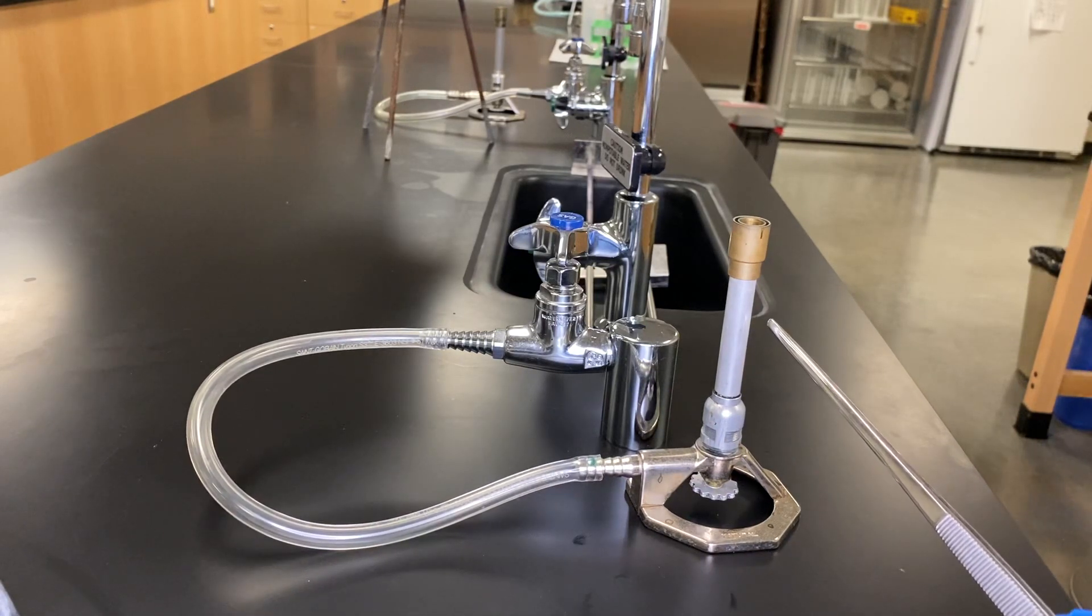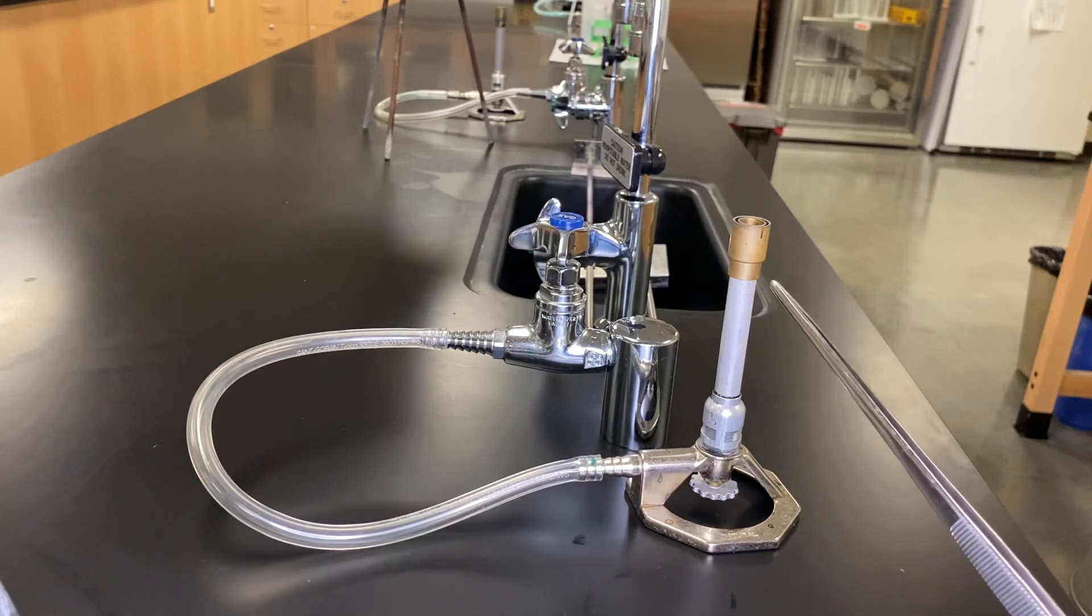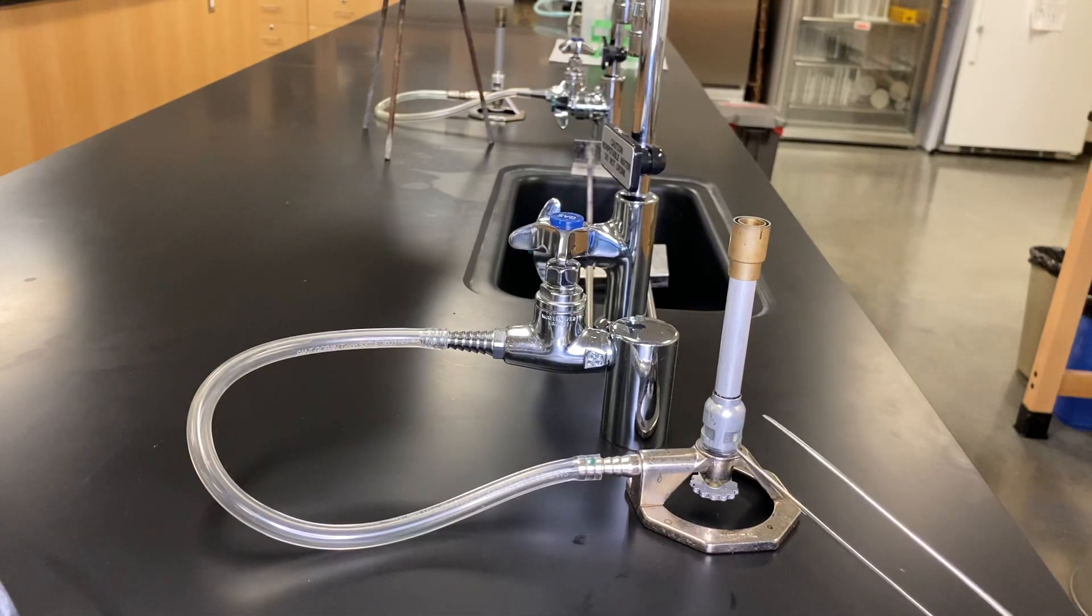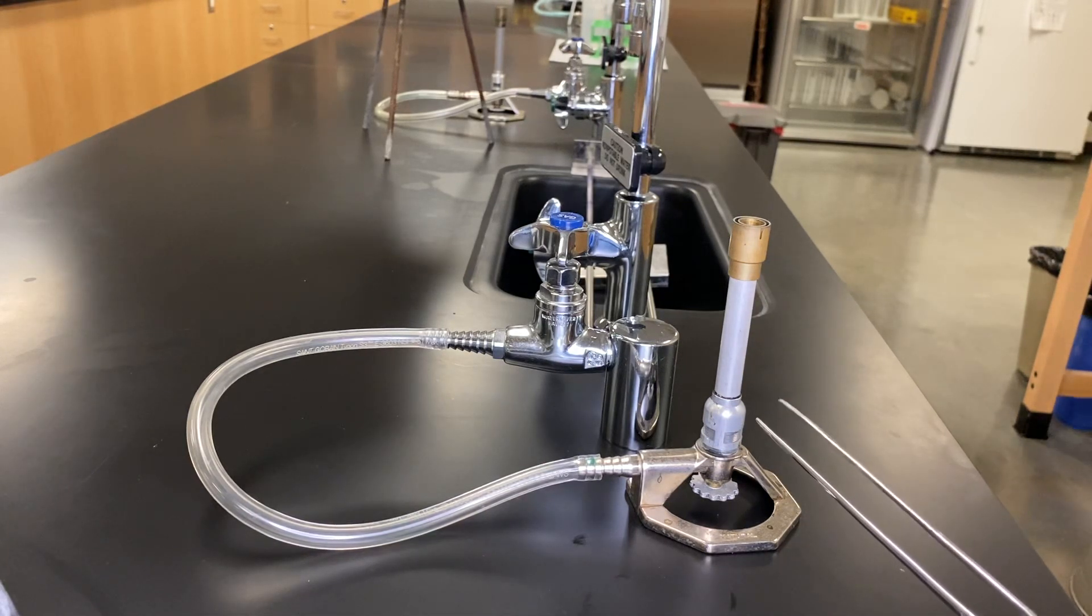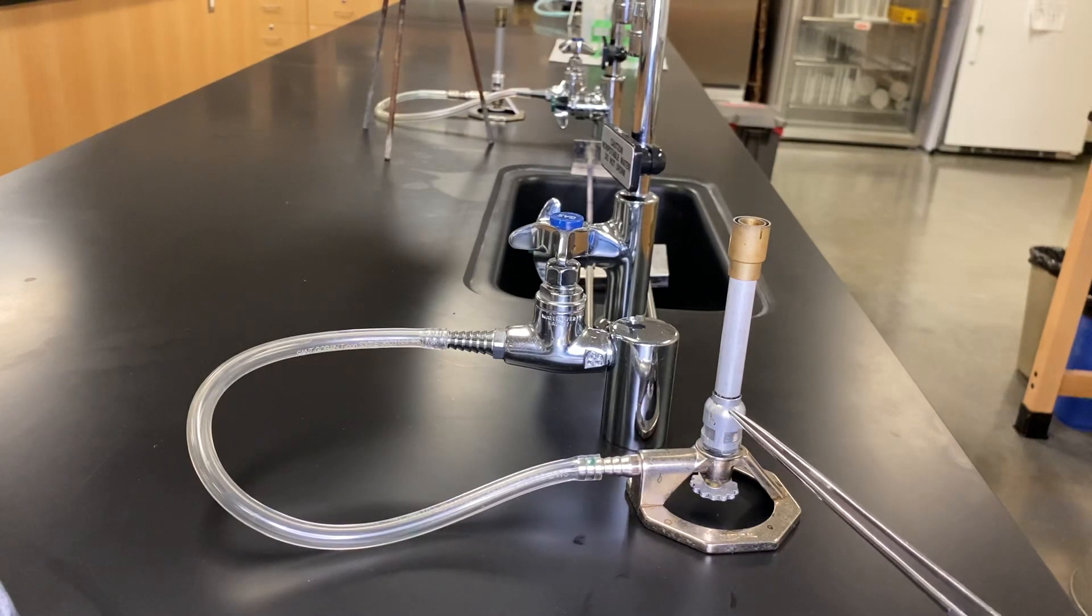We have our basic barrel, a little collar, two of these things that we're really not going to touch. What we're interested in is this little vent right here. This guy, which actually rotates clockwise and counterclockwise, is important because this is really not necessarily an air vent, it's an oxygen vent.